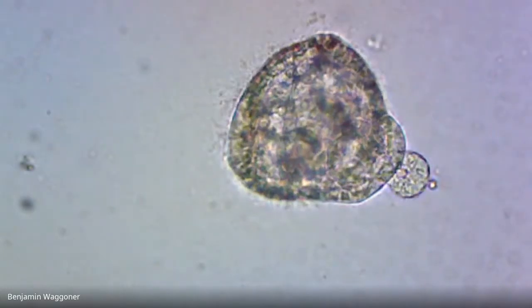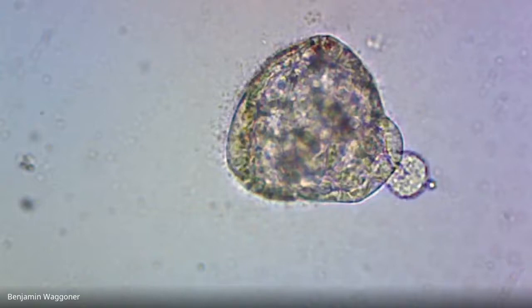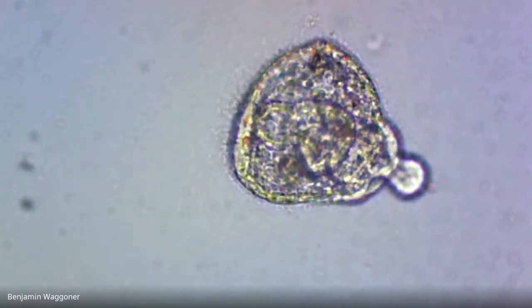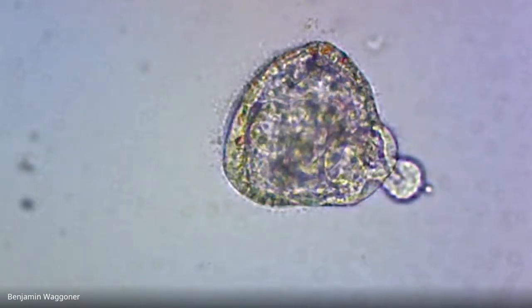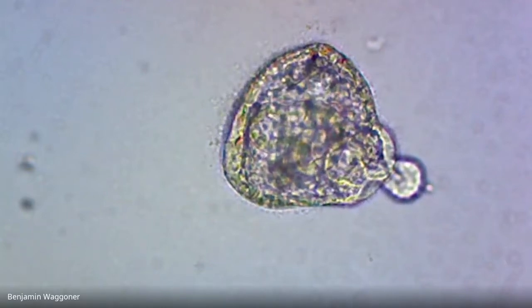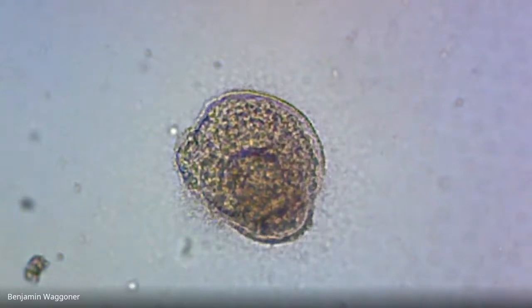Okay, there's another prism larva with that schnoz sticking out, where the contractile cells are in fact starting to contract. And that might be the mouth up there at the front at about your 8 o'clock, with the gut going completely through. So yeah, I'd be willing to call that one prism. And that one's just covered in bacteria and schmood.